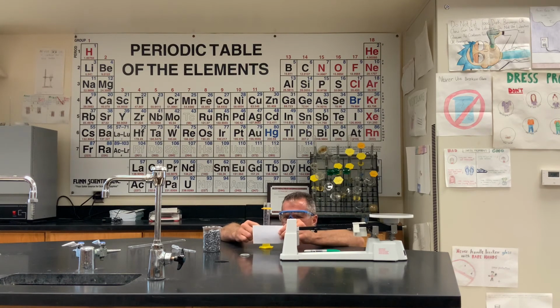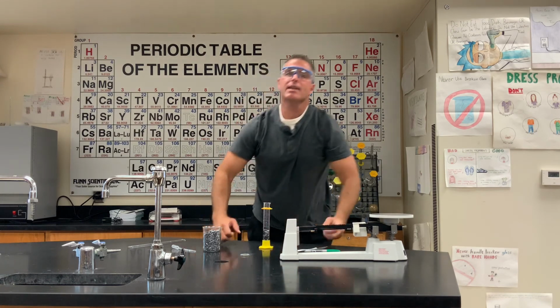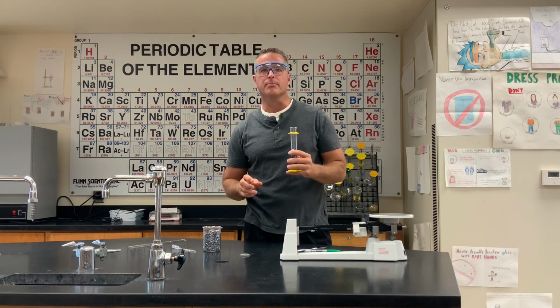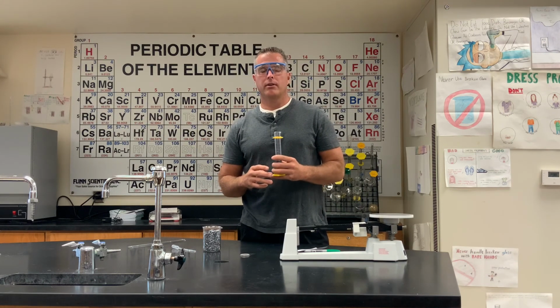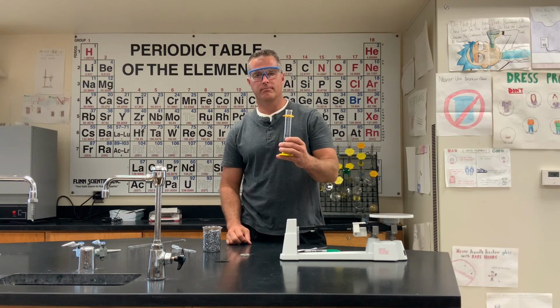And it went up to just below 30, so we're going to call that 29.8 milliliters. All right. So now you have the mass, you have the volume by water displacement. You'll be able to figure out the density of this guy, and then hopefully what these space rocks actually are.